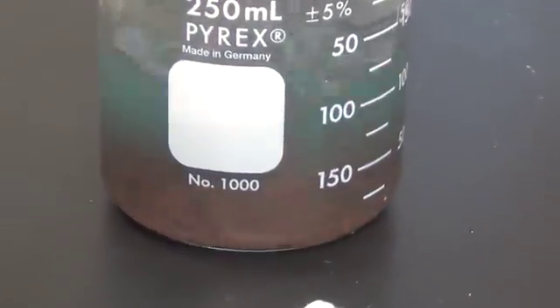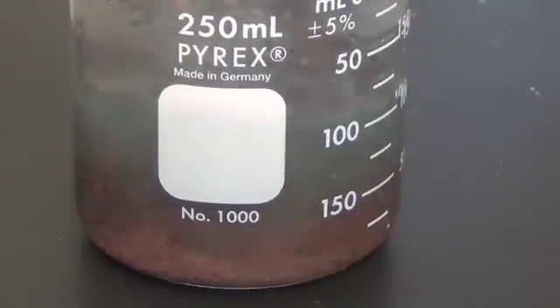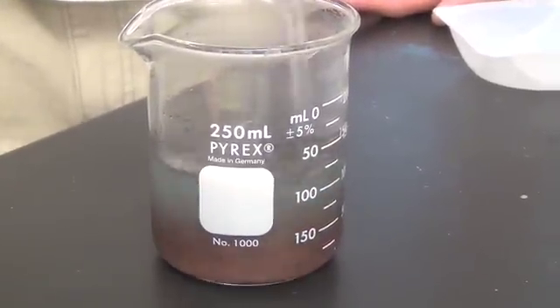And the solutions are getting close to clear. It's really hot. It's really warm. Oh yeah, it kind of looks like brown beef. Yeah, there's condensation. No, this worked a lot faster. Alright, and then we can't account for why that happened.